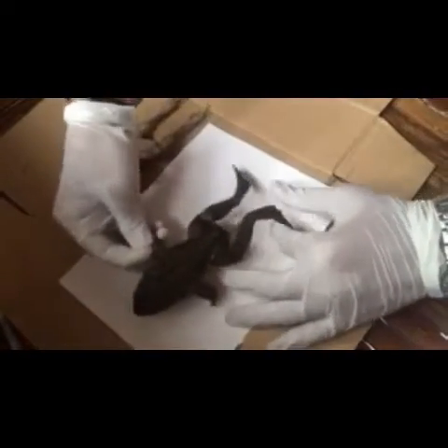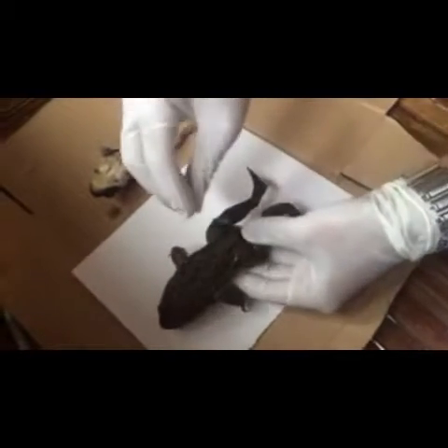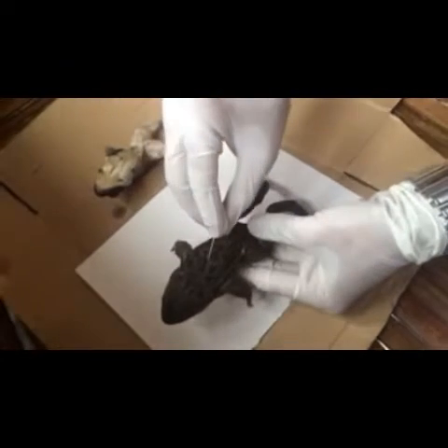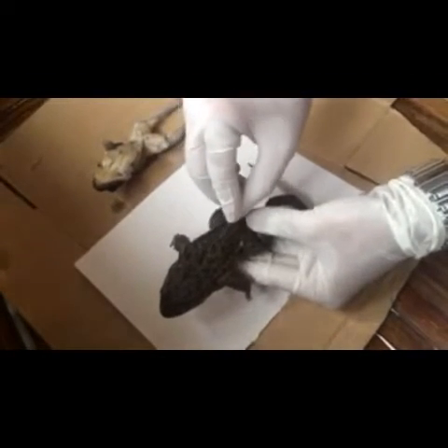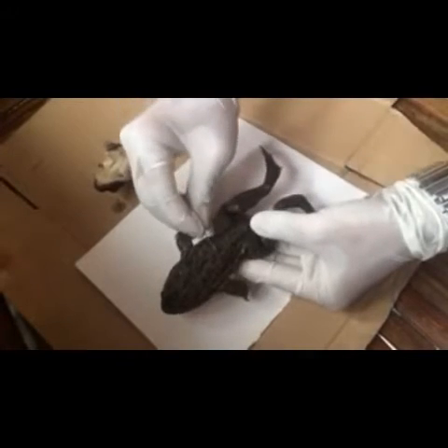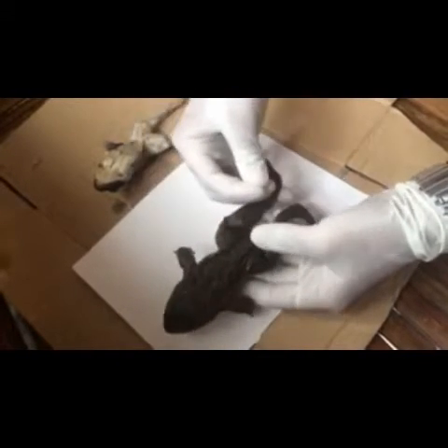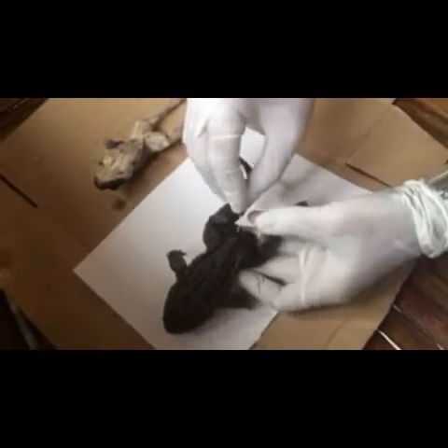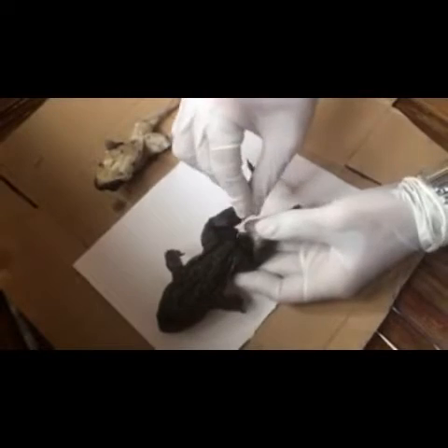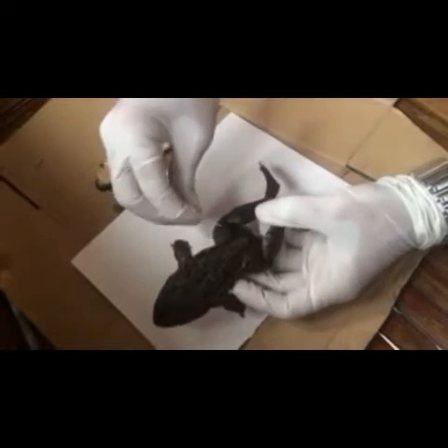We will go to the body. This is the median dorsal line at the center. And then this is the hump. And then the anus, here.